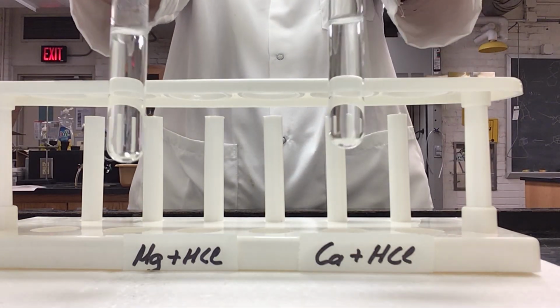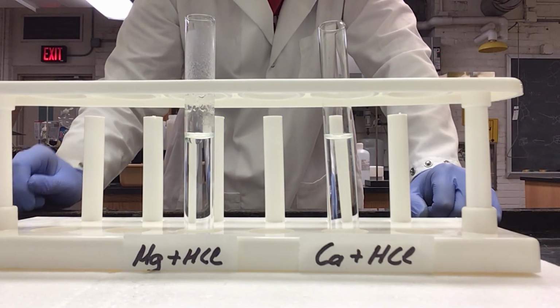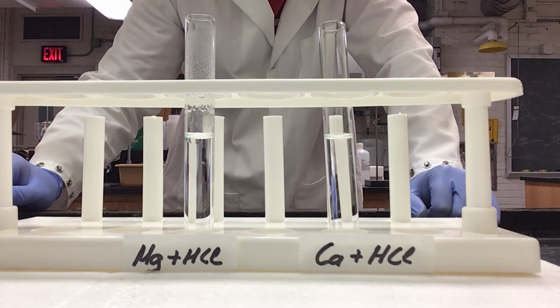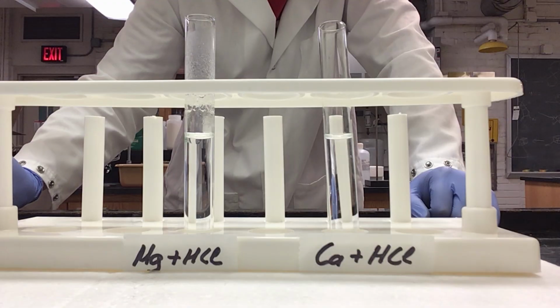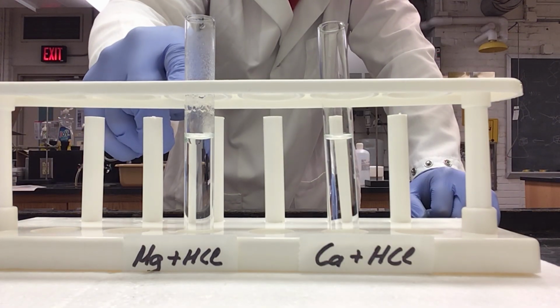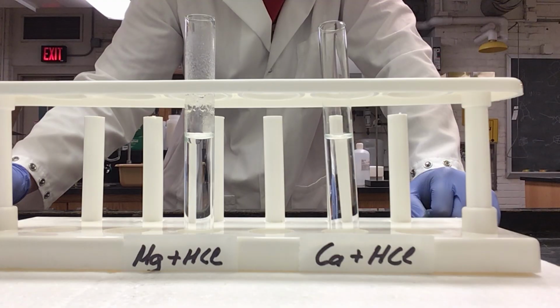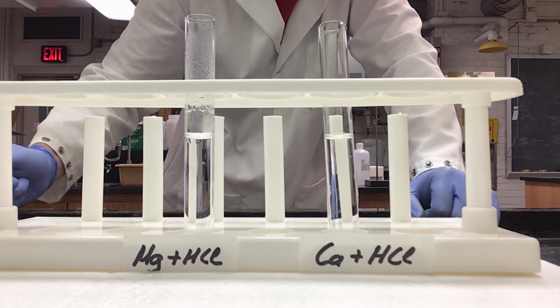You can see there's no trace of either of our metals remaining. Our calcium reacted incredibly vigorously, reacting almost fully with the hydrochloric acid in a short moment. Our magnesium took longer to totally react and dissolve, and you can see that heat was produced from each test tube. Primarily, more heat was being produced in our magnesium, as evidenced by the water droplets that are now forming on the top of the test tube from the steam that was escaping.